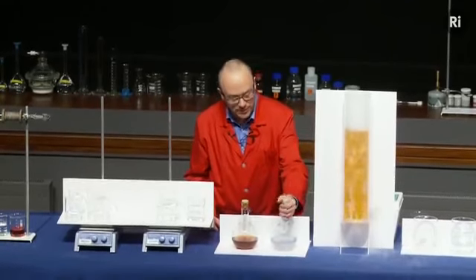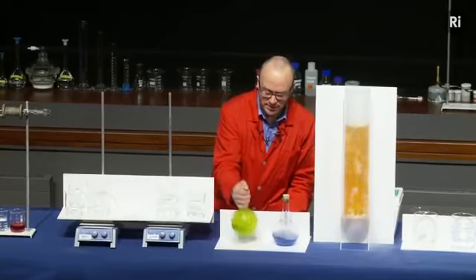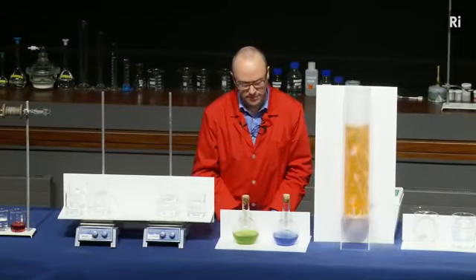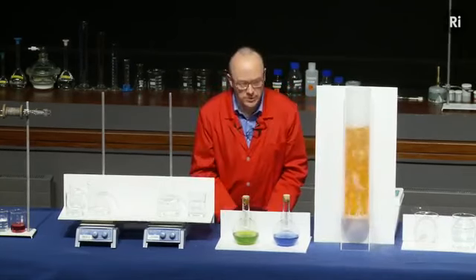So it's going back through that sequence of colours again. And what's more, I can even repeat it. So if I shake it again, it goes back to being blue. If I shake this again, it goes back to being red, and so on. And if I wait, it will go back. So again, it looks as if we have a chemical reaction that's going backwards.